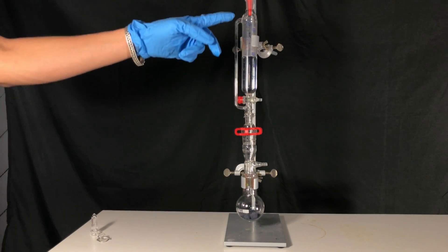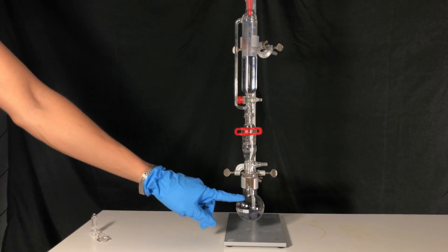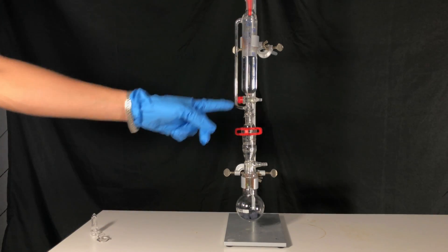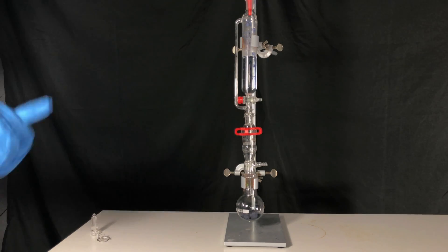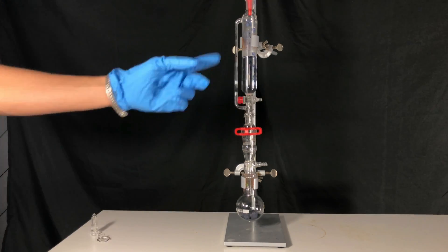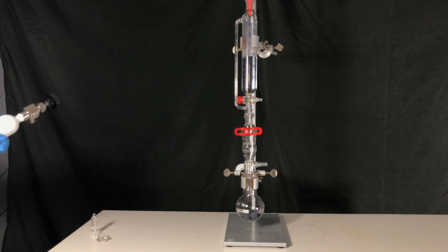You can see that there is still plenty of air in our apparatus. All of that air can lead to an explosion because silane is pyrophoric.